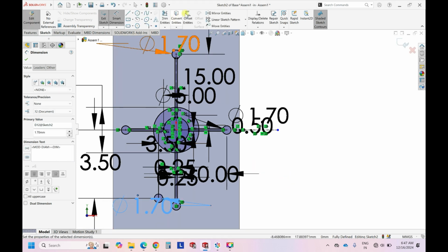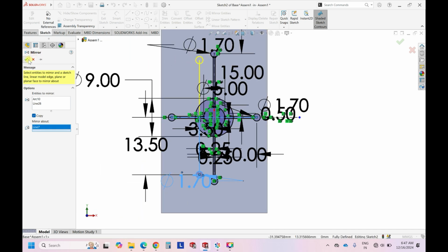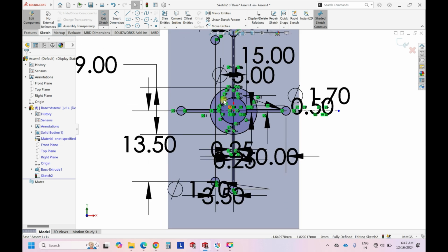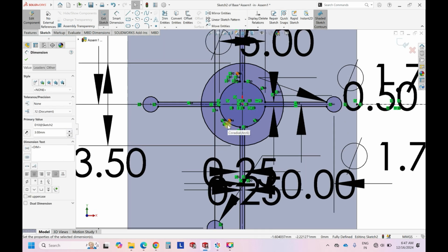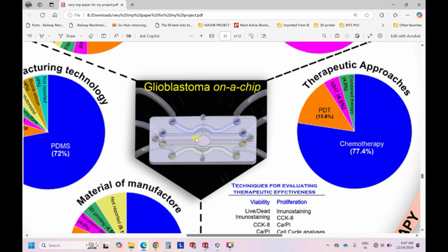Okay, so now next thing is you just do the mirror entities. Choose this and this, and we have to mirror about the center line. So you can see this here, right? So everything is ready. If you are feeling that the dimension that we gave, in between this and this, is around 3.5, right? So this 3.5 you can decrease, let's say 3 mm. Yeah, 3 mm is fine. Because from this channel, if you see, this line is far but the circle is close.